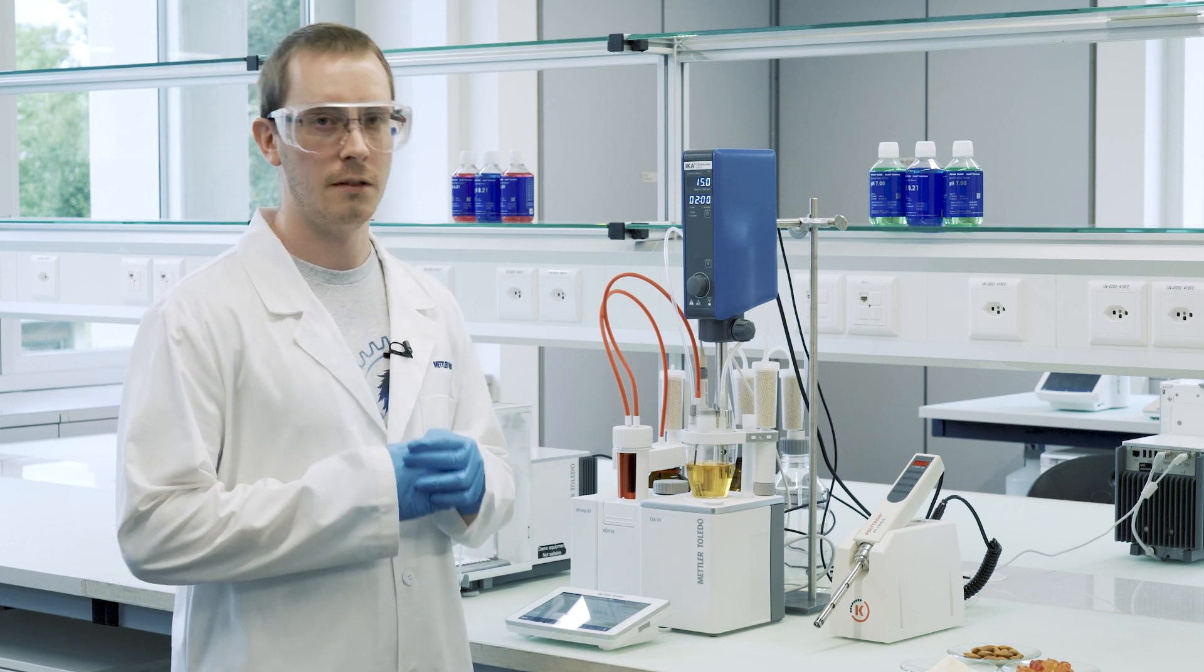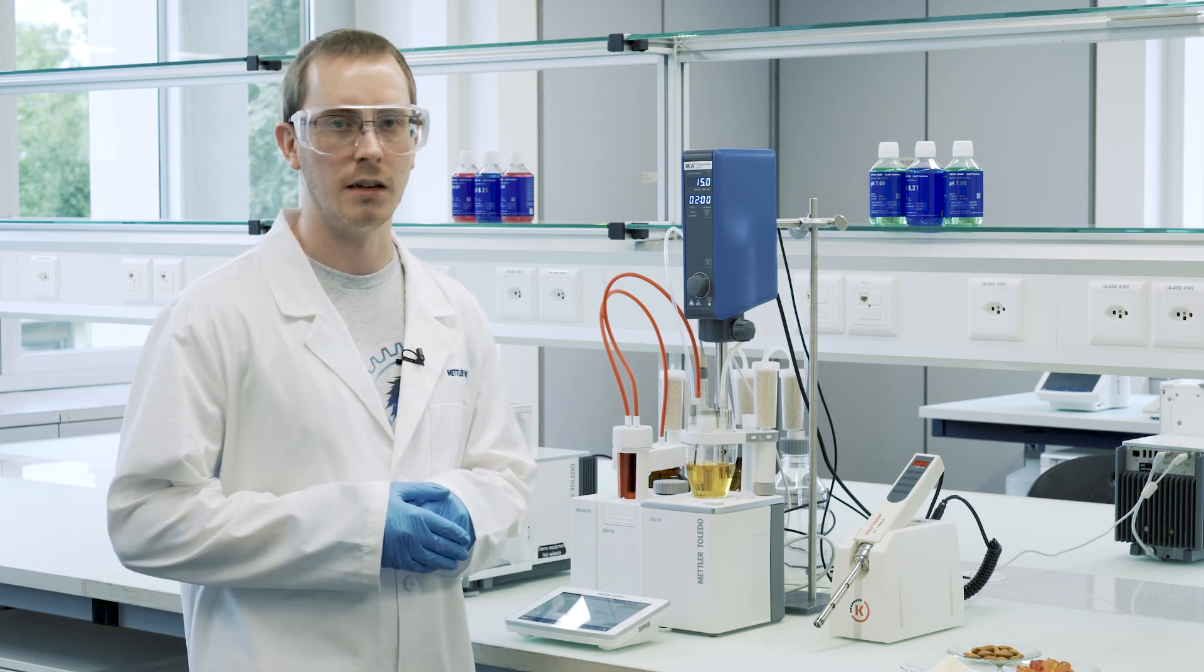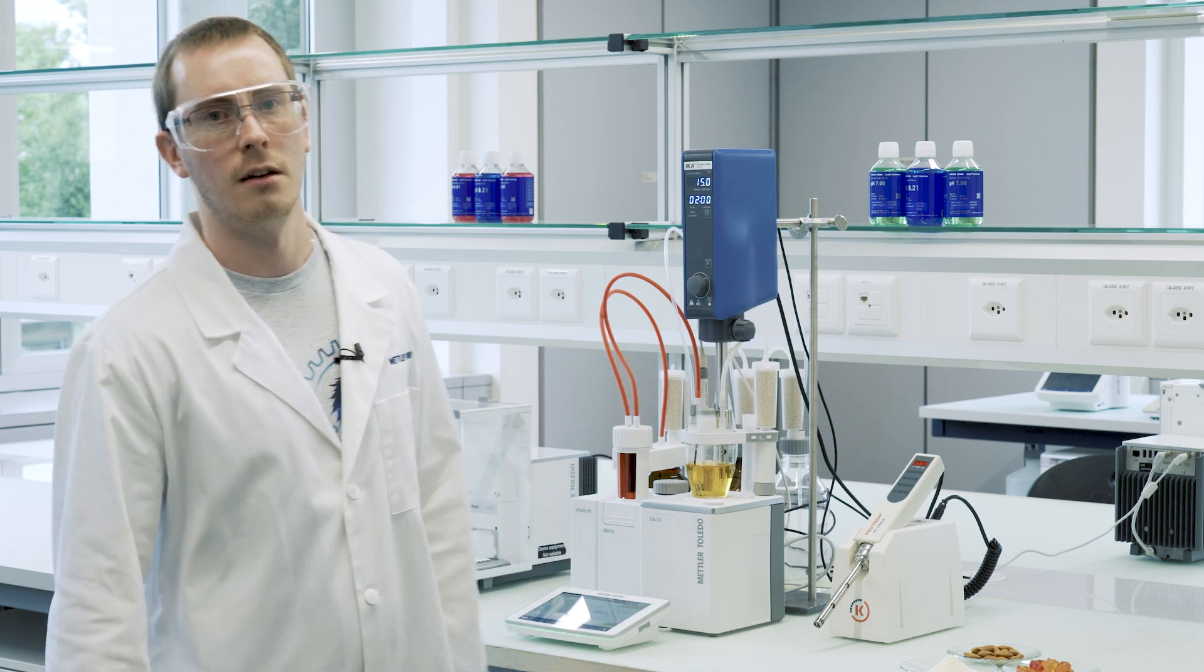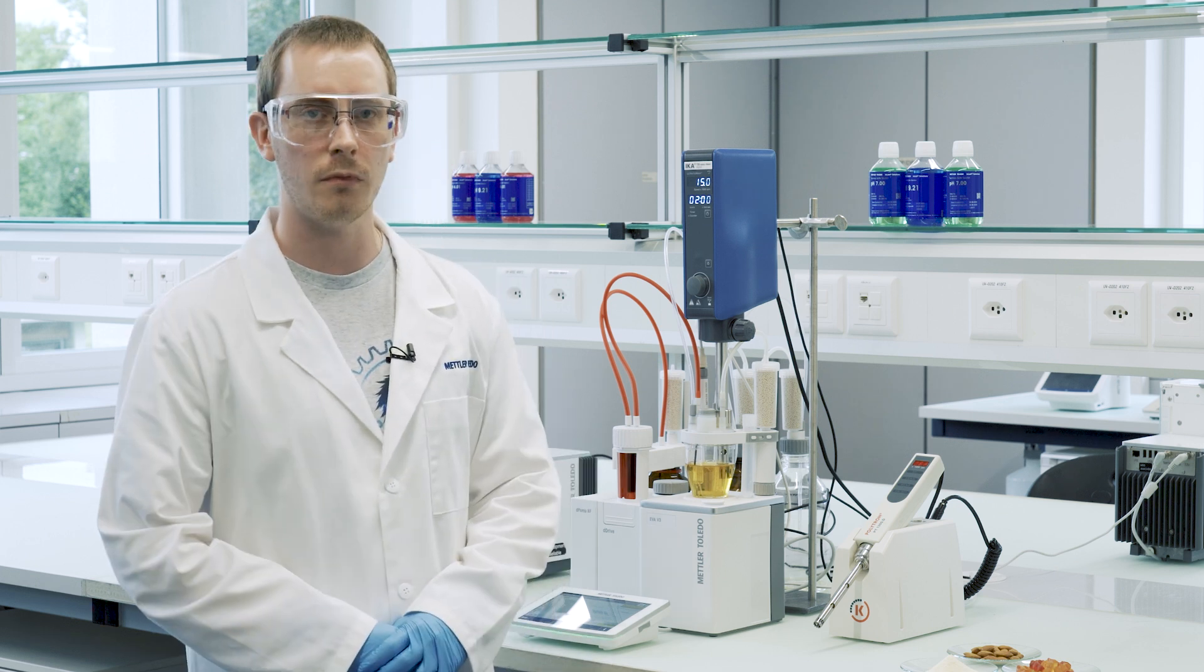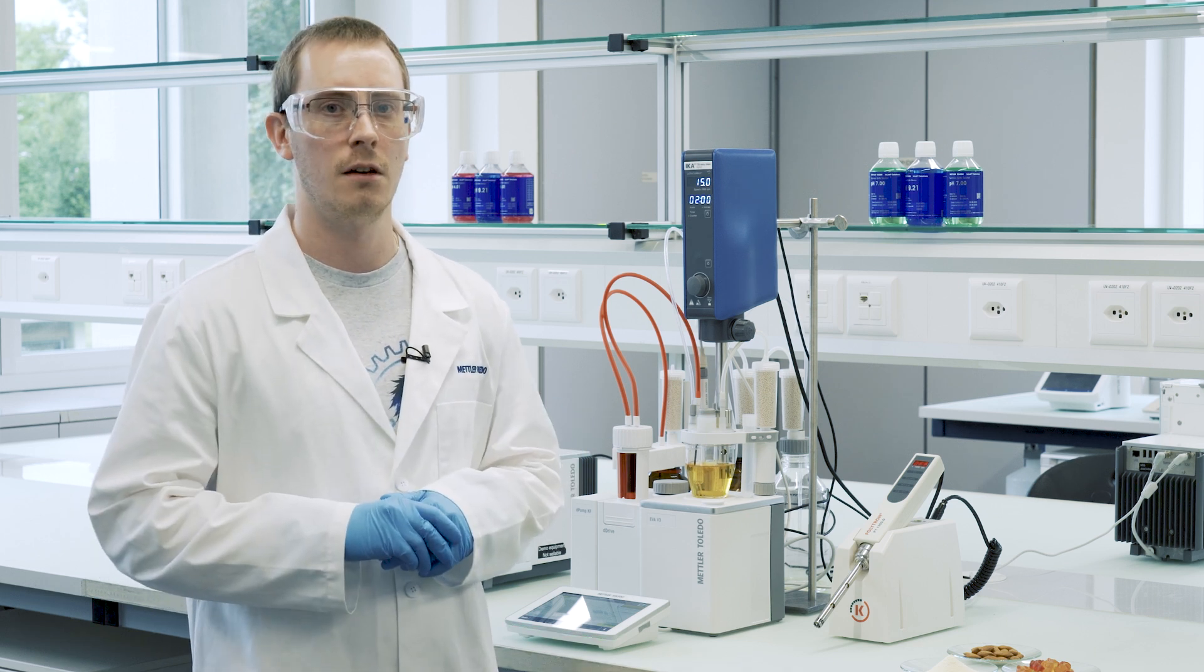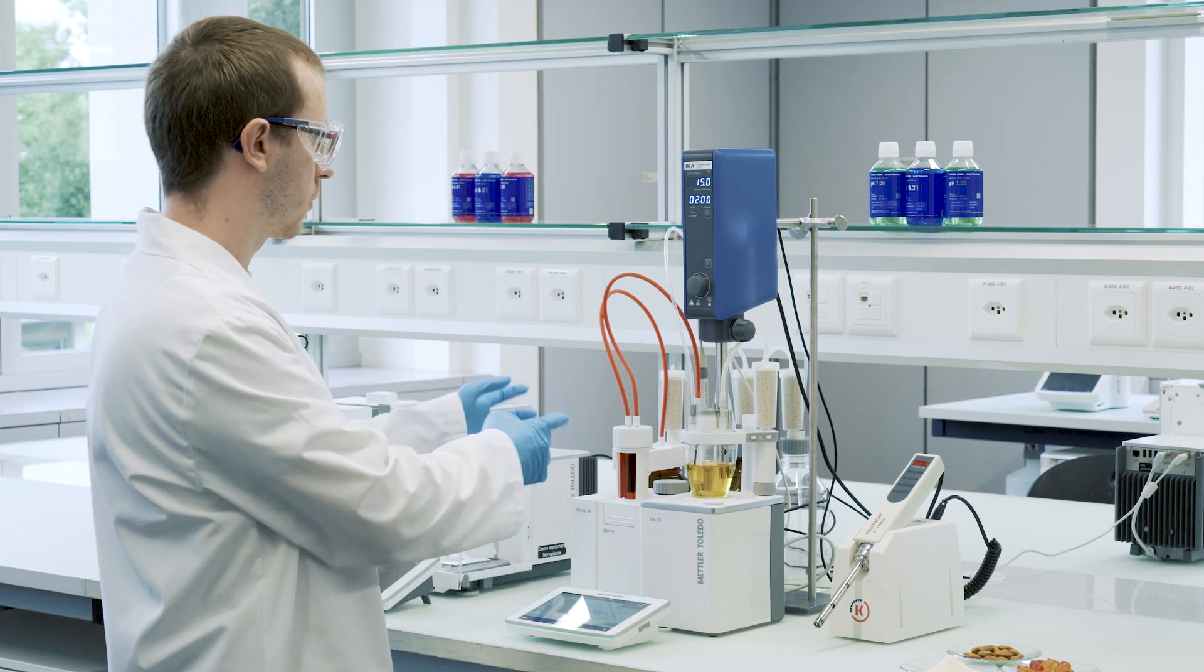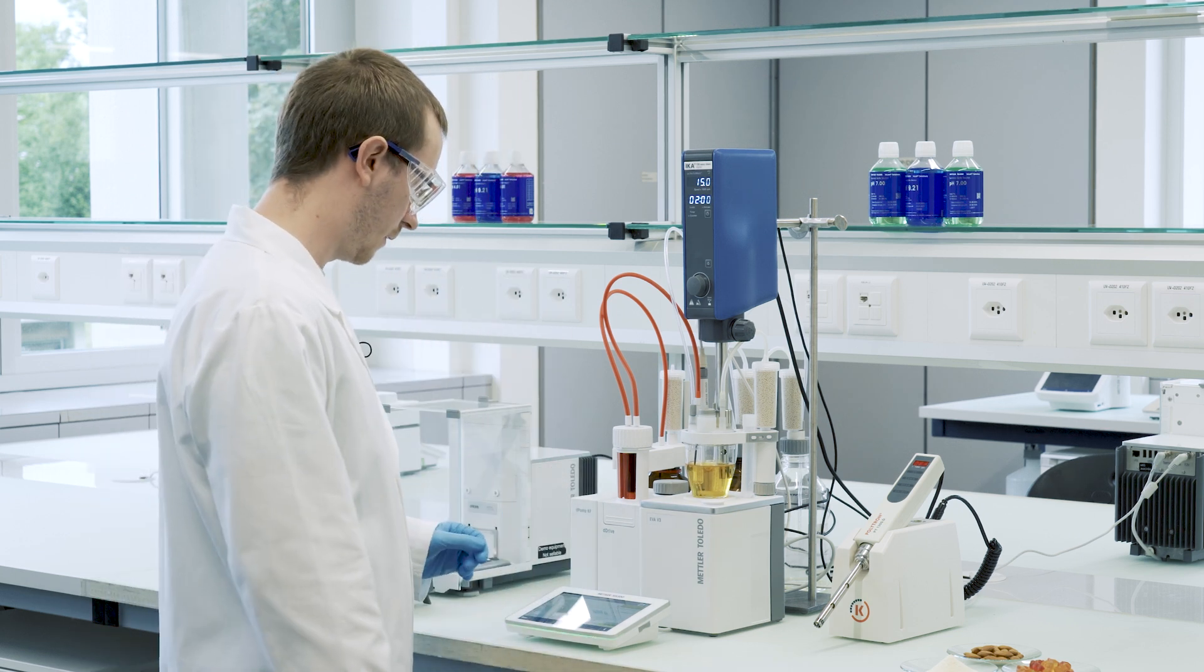We recommend to measure blanks beforehand because the homogenizer can introduce an increased amount of water while running than just this standby situation here. You would turn on the homogenizer for the exact same amount of time and the exact same speed as you do in the analysis and measure the water content that is being added by this homogenization step, and we have already done these as well.